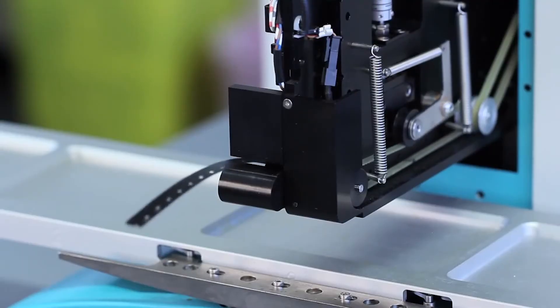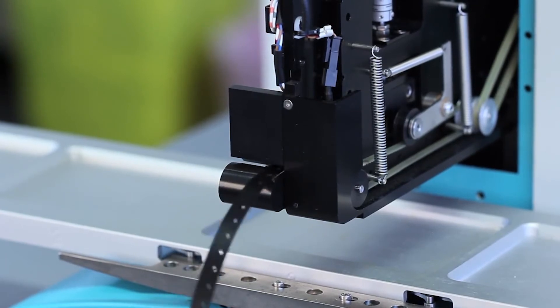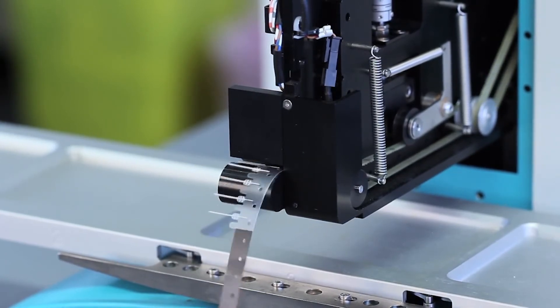And as you can see, the tape comes through. And we're now ready to go.